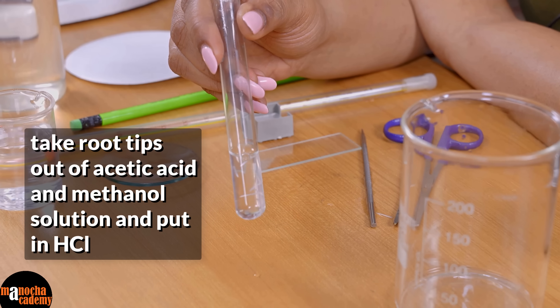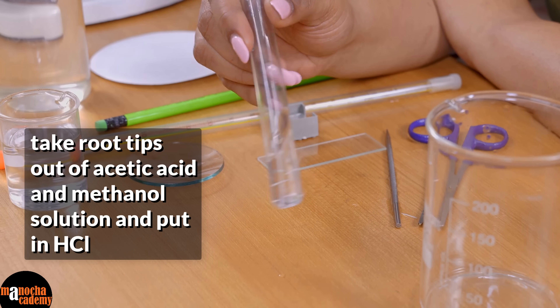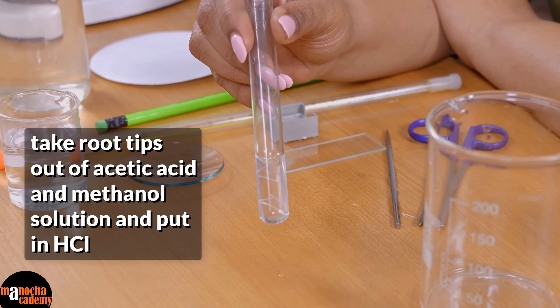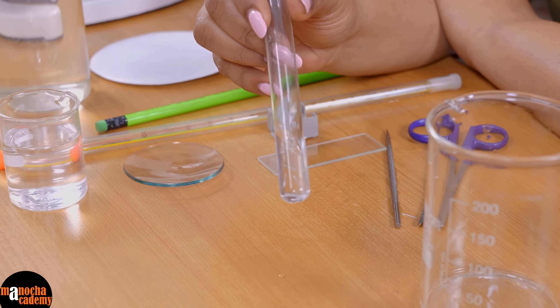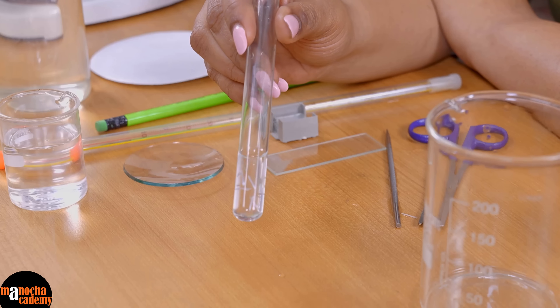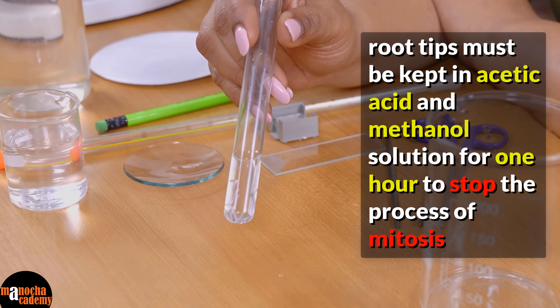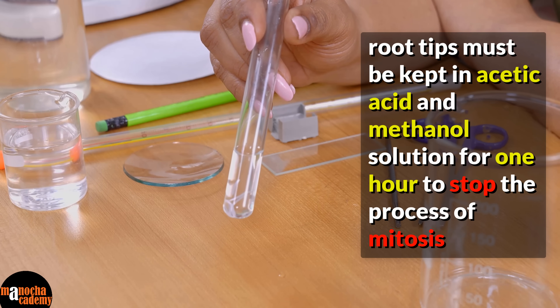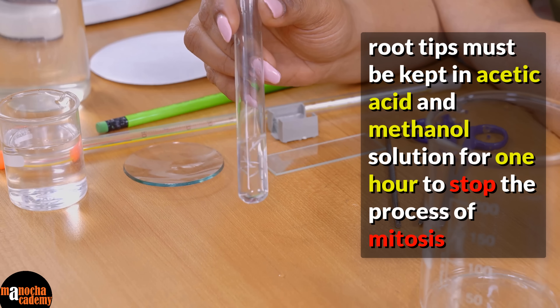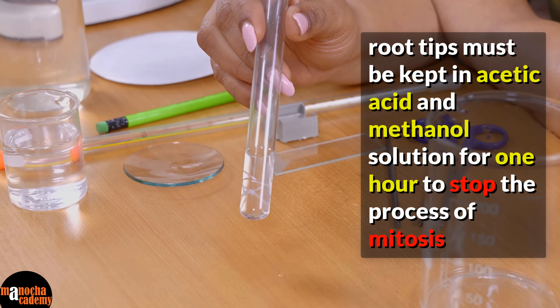This process of putting it in acetic acid and methanol and then in hydrochloric acid is already done before you start your experiment in the laboratory. You will be given root tips which are present in hydrochloric acid. It takes about 1 hour to fix this with acetic acid and methanol. We fix it because we want the cells of the root tip to stop at whatever stage of mitosis they are in.